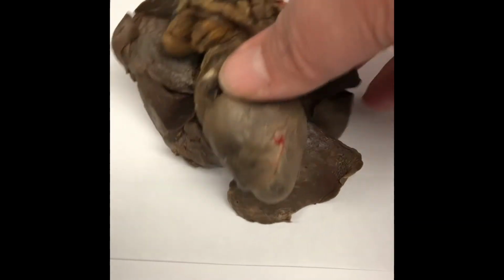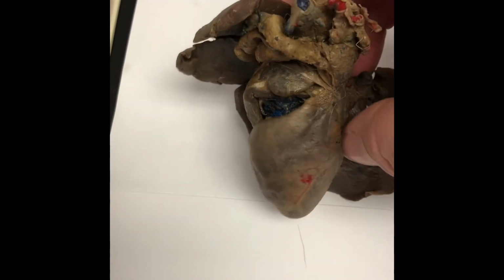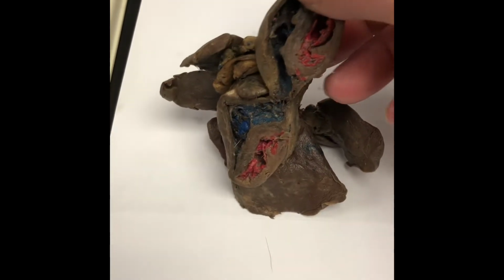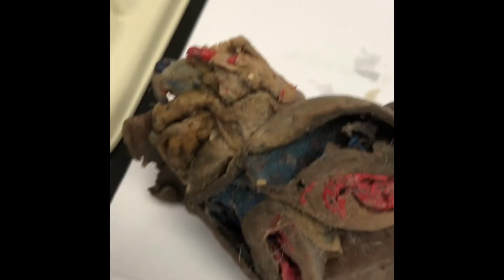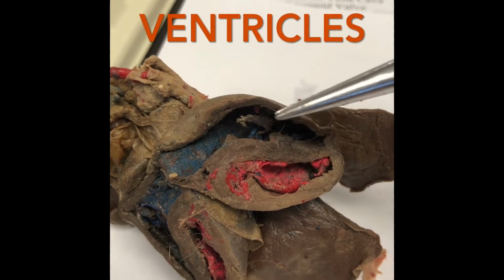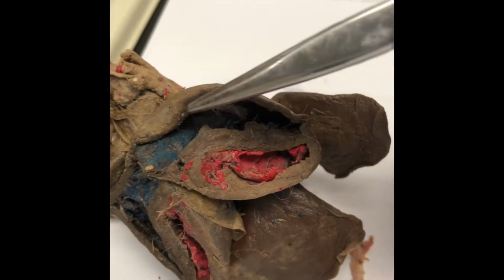There's the inferior vena cava going off the bottom of the heart. Here's the heart and lungs of the cat. You can see the trachea again, the superior vena cava, and the aorta off the top. As I open it up, you can see the right side dyed in blue, atrium at the top, ventricles at the bottom. And then you can see the left side dyed red, ventricles at the bottom, atrium chambers at the top of the heart. So ventricles here, atrium up top there.